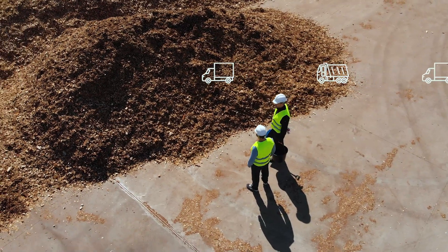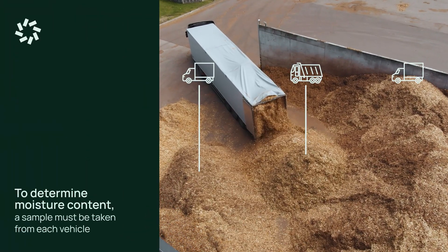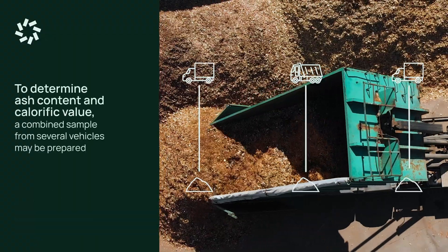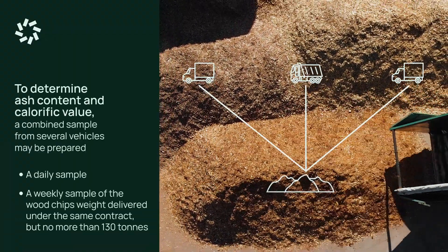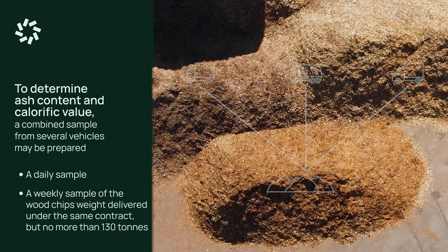To determine moisture content, a sample must be taken from each delivered vehicle. To determine calorific value and ash content, a combined sample may be prepared.